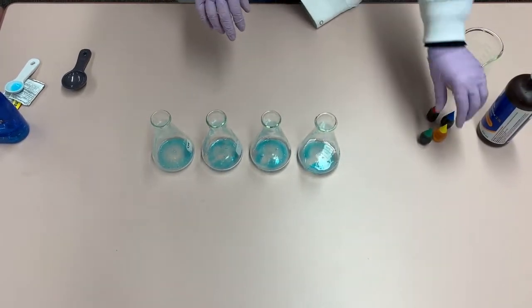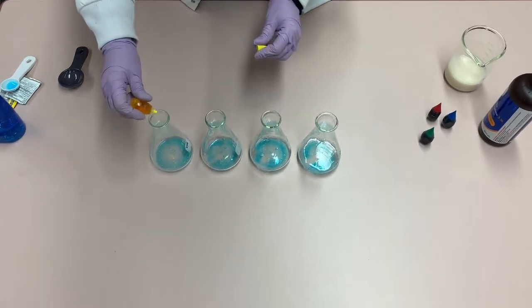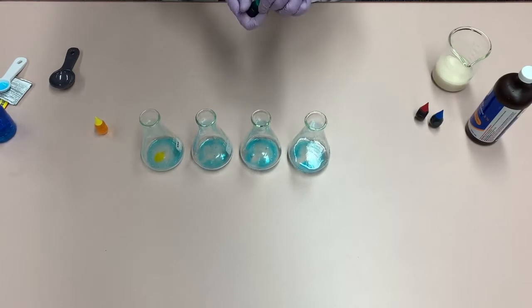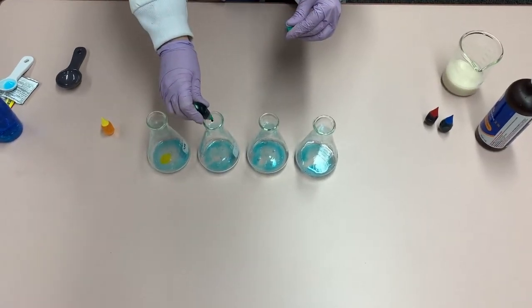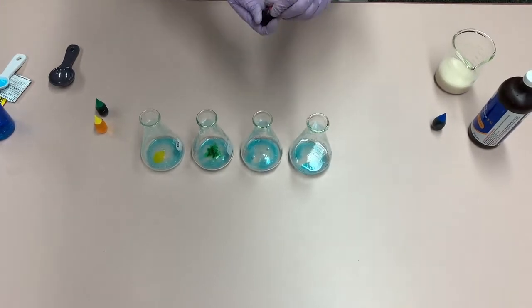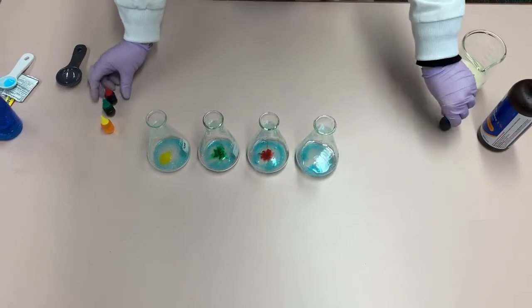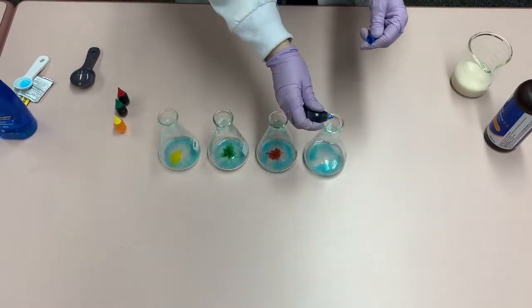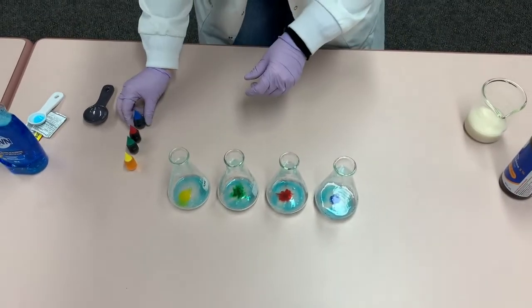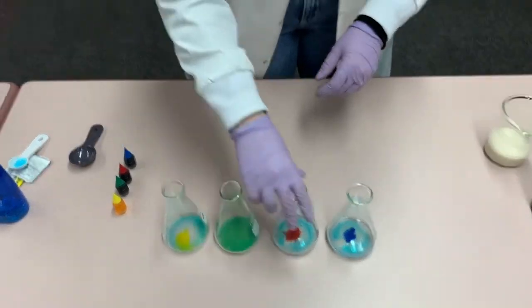Next, we add one drop of food coloring to each of the four flasks, and then swirl each flask to mix.